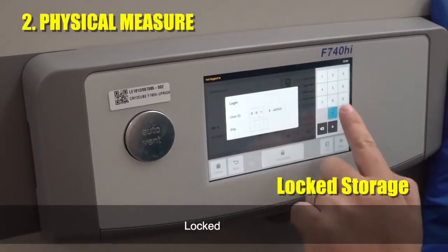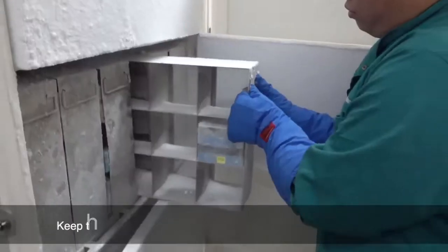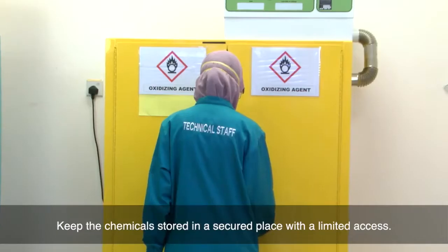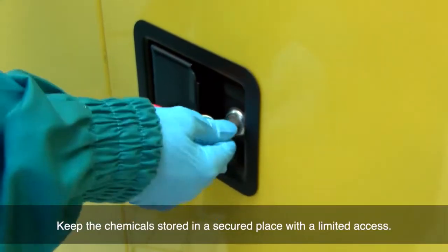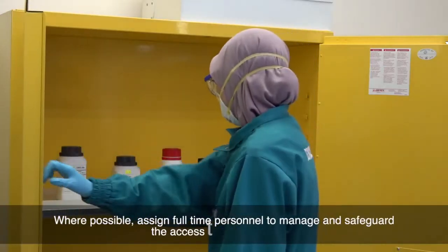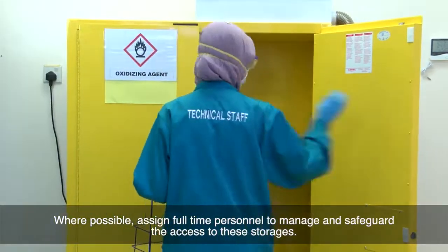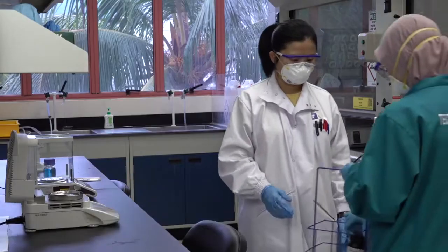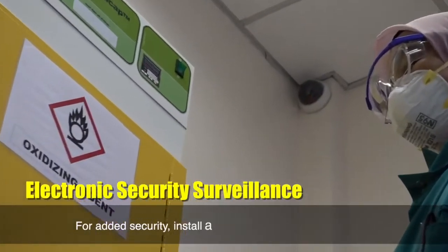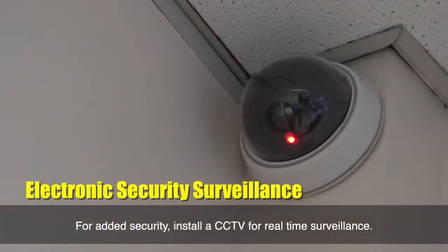The fourth pillar is locked storage. Keep chemicals stored in a secured place with limited access. Where possible, assign full-time personnel to manage and safeguard access to this storage. For added security, install a CCTV for real-time surveillance.